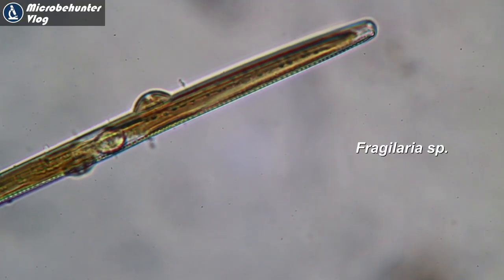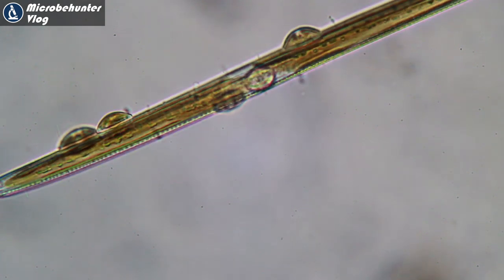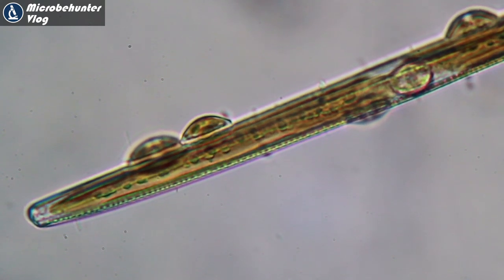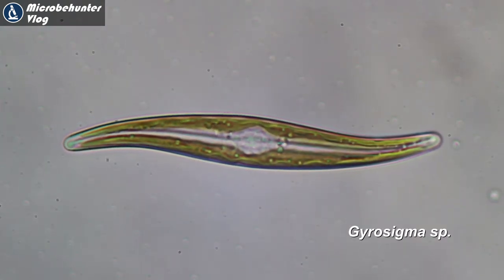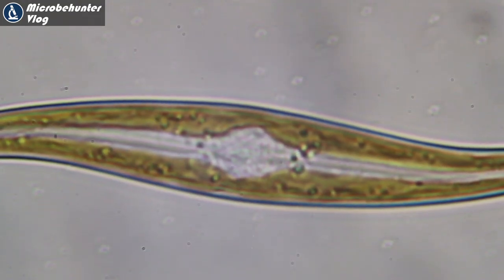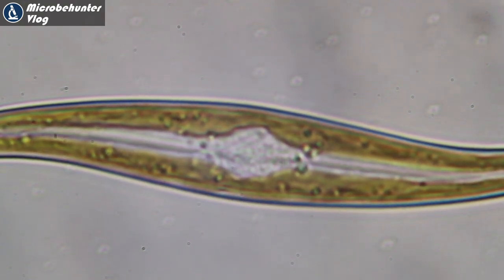I think this must be a rotifer or something — this was actually the only one I found, so I was quite lucky about that. They have a foot with which they're able to attach themselves. You'll notice they're also a little bit green in the middle, and the reason is because those are the algae and diatoms it has eaten. Here's yet another diatom with smaller diatoms attached to the larger one — a slightly different shape again. The white clear center could quite well be the nucleus of the cell.